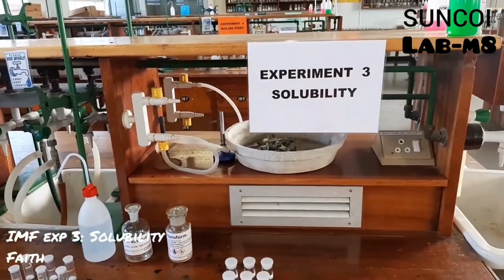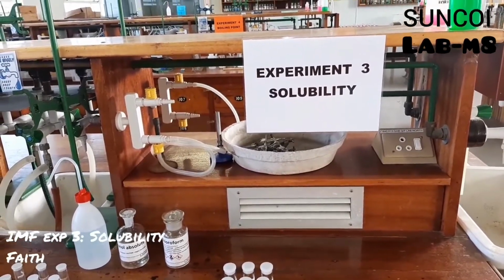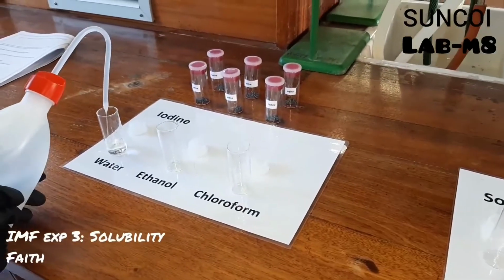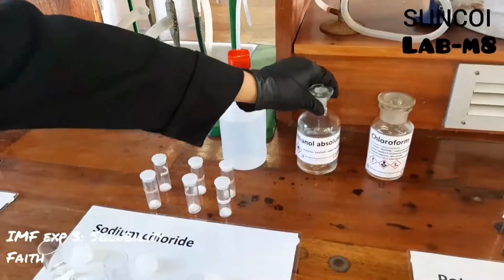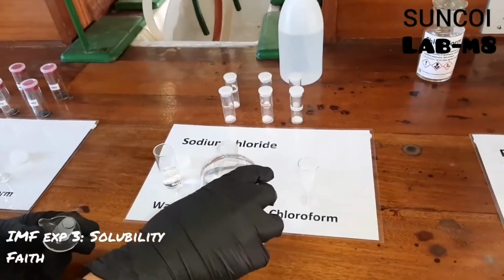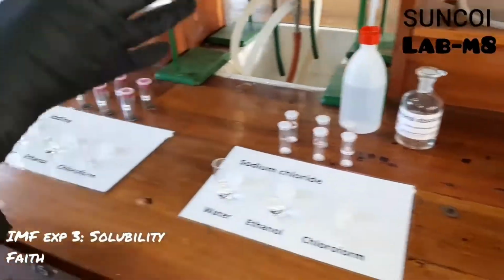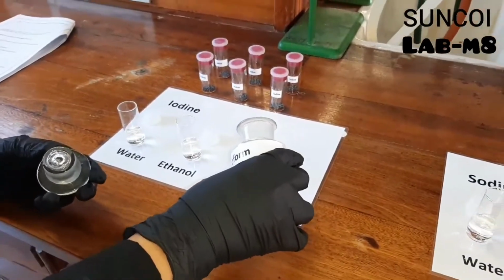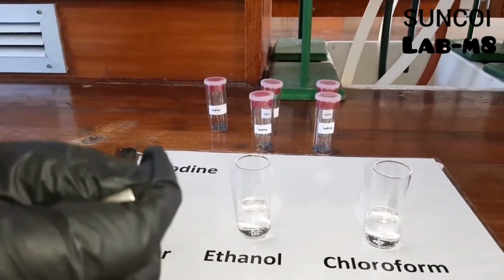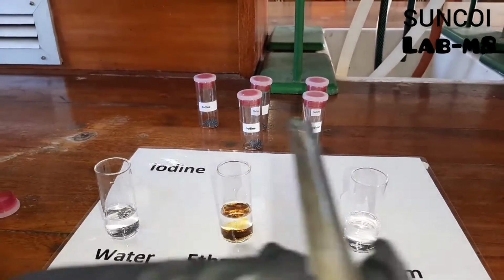Faith is going to demonstrate one of the intermolecular forces experiments, and that is experiment 3, solubility. So for today's practical, we are going to try and dissolve 3 different substances in 3 different solvents. Faith is now adding water to her vials, then ethanol, and finally chloroform. Those are 3 solvents. Then the first substance she's going to dissolve is iodine, and she's adding iodine to water, iodine to ethanol, and then iodine to chloroform.